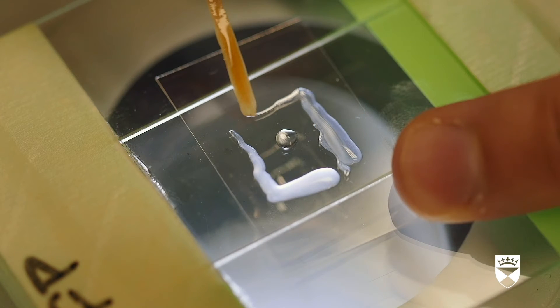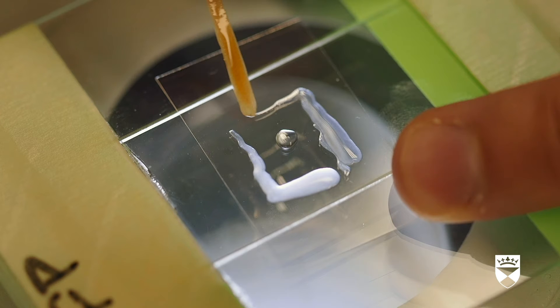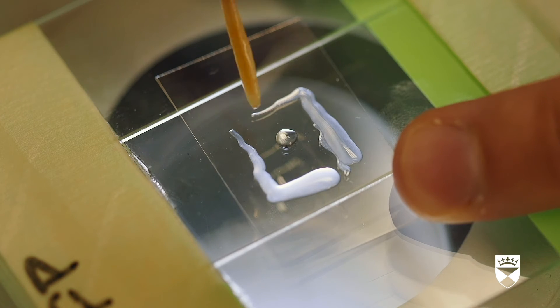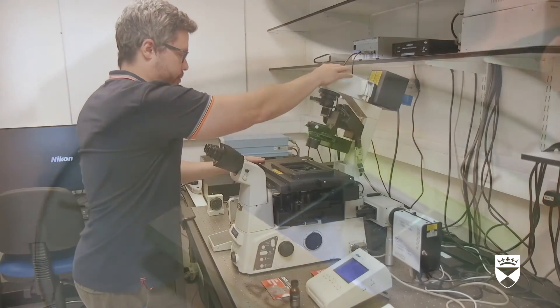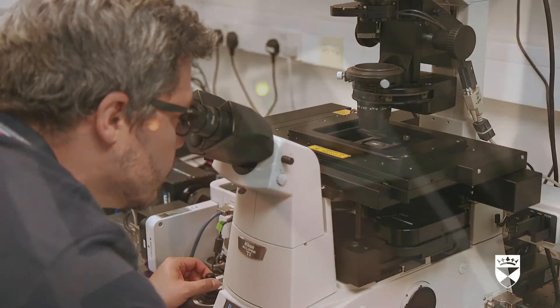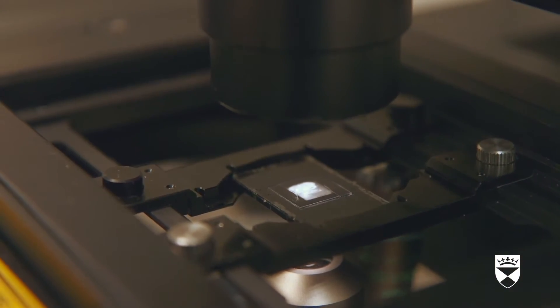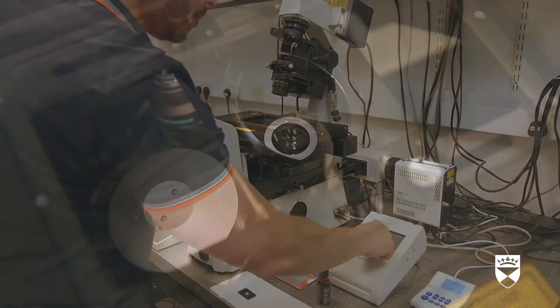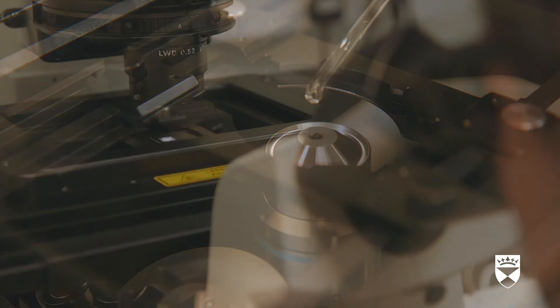The scientist spreads a clear liquid over a clear slide, then covers it in a casing, places the slide into a fluorescence microscope, and looks through the eyepiece. Without proper gametes, offspring cannot be produced. The first step to study how an egg cell develops is to collect some oocytes. To do this, we need to open the worm to get to them. We then record the live oocytes we have dissected from worms and observe what happens under a fluorescence microscope.